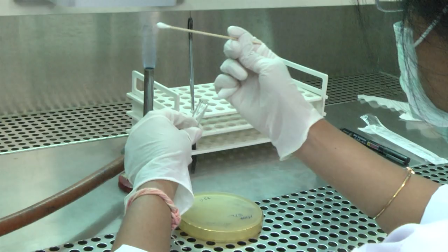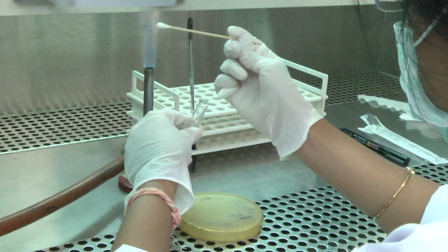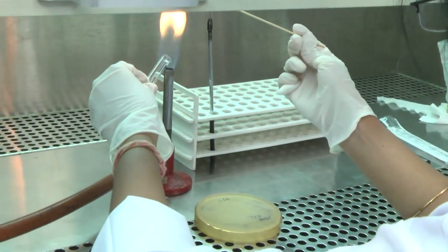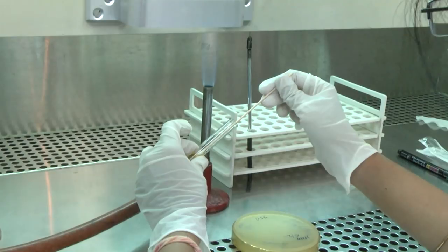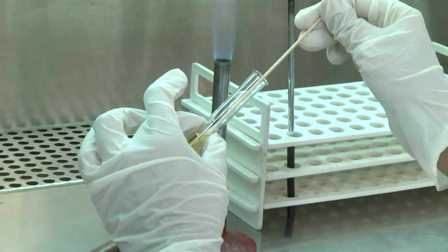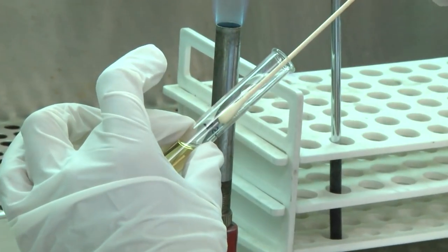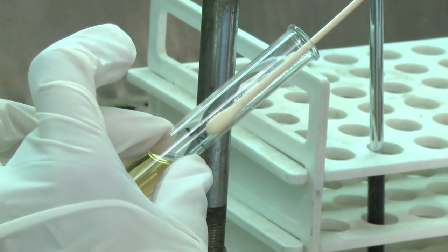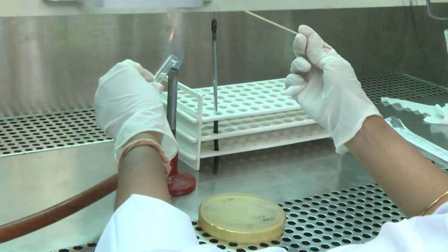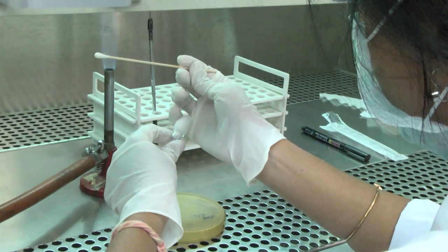Remove the cap or cotton wool plug of the bottle or test tube with the little finger of your right hand and flame the neck. Load the inoculum onto a sterilized cotton swab. Squeeze out the extra inoculum by pressing the swab to the side of the test tube or bottle. Flame the neck of the bottle or test tube and replace the cap or plug.